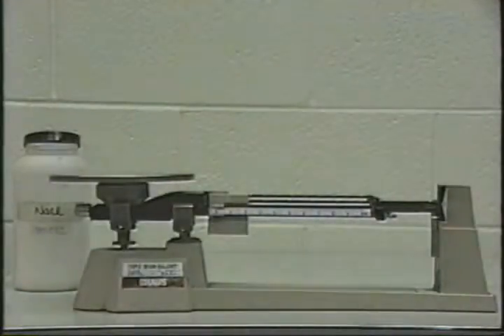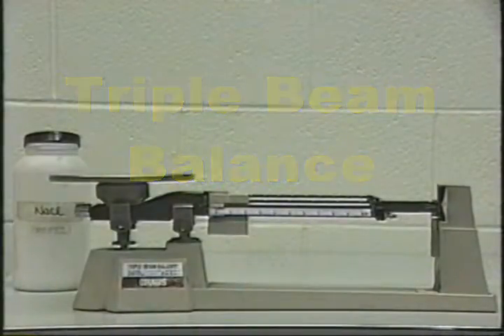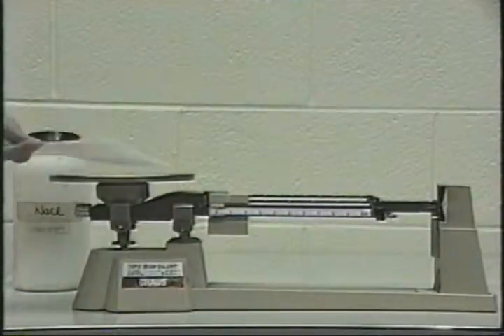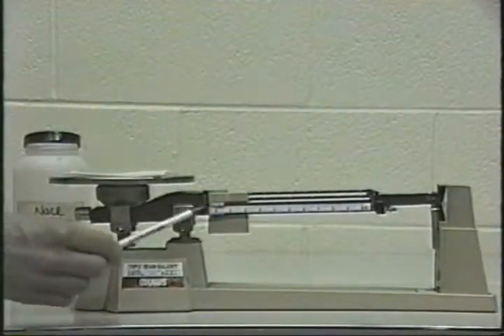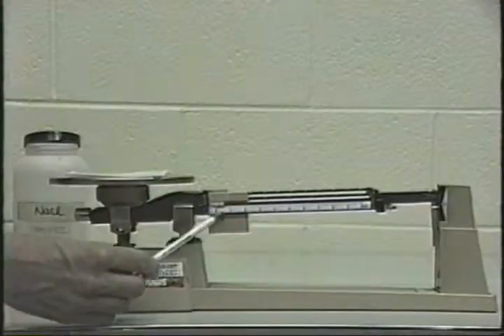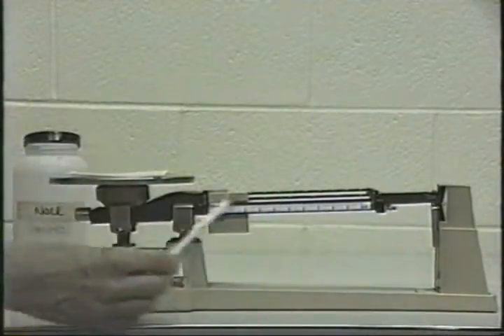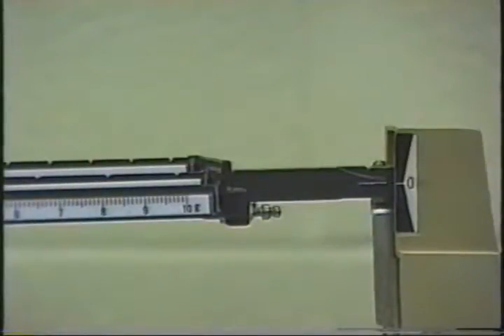Now let's turn our attention to actually carrying out this reaction. We'll start by weighing out 17 grams of salt on a triple beam balance. Now, since we'll be weighing the salt on a piece of paper, we don't have to zero the balance first, but we must weigh the paper accurately. We'll put the paper on and then move the rider up the beam here until the beam goes back to zero here.